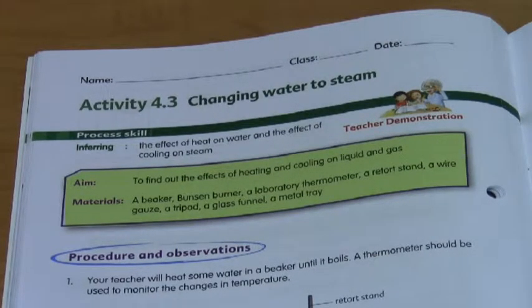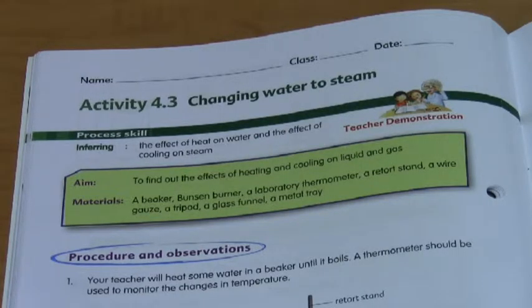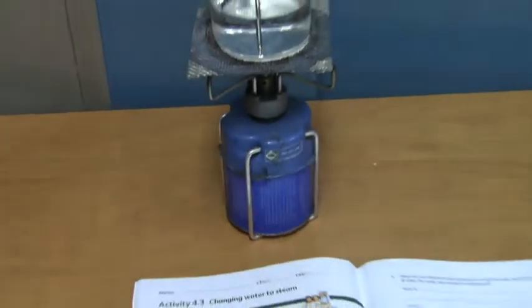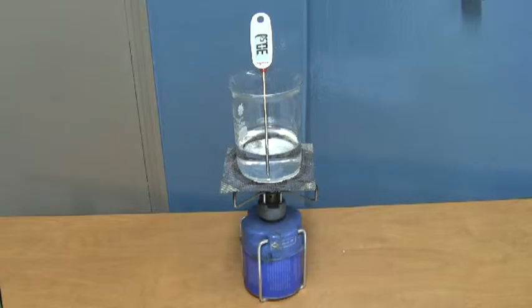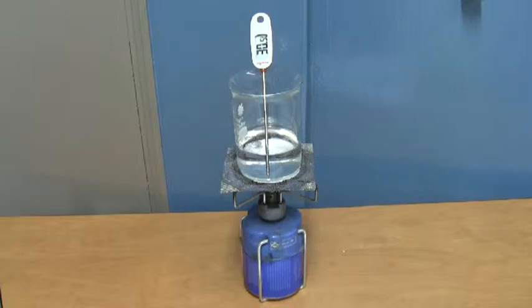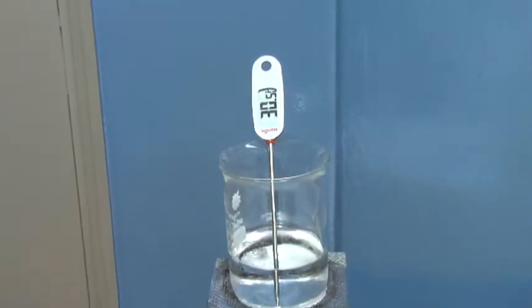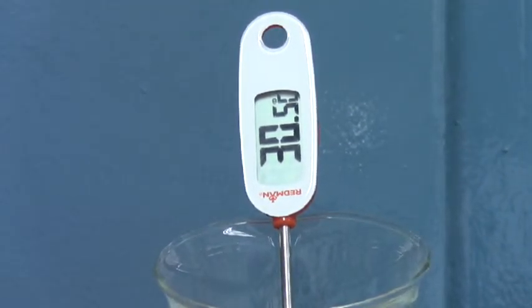This is activity 4.3 on changing water into steam. The aim of this activity is to find out the effects of heating and cooling on liquid and gas. We have 200 milliliters of tap water in a beaker on top of a burner, and the starting temperature of the water at the start of the experiment is 30.5 degrees Celsius.